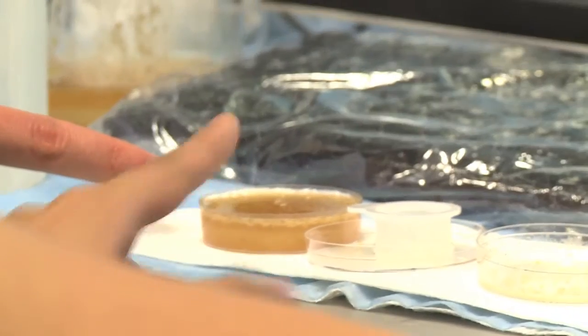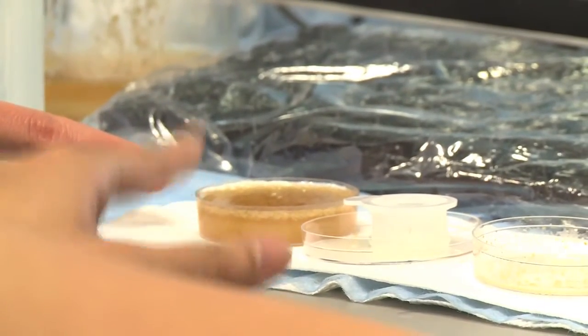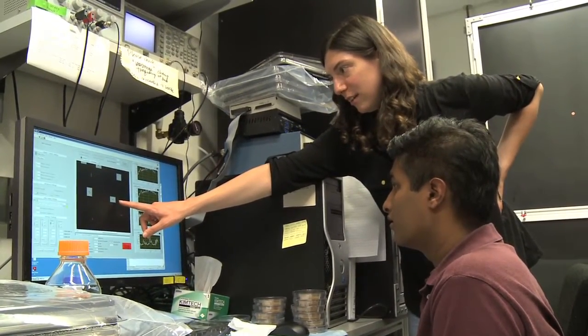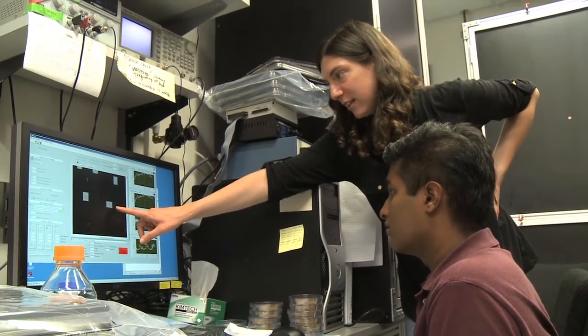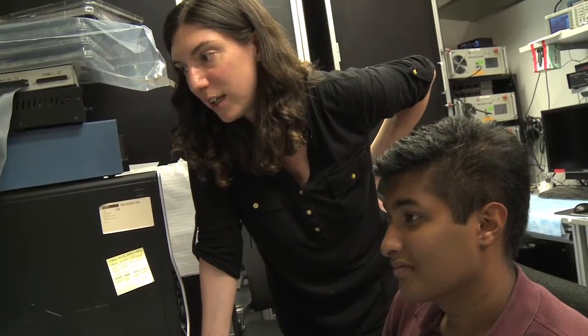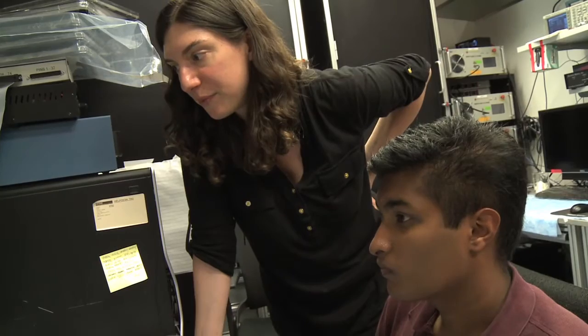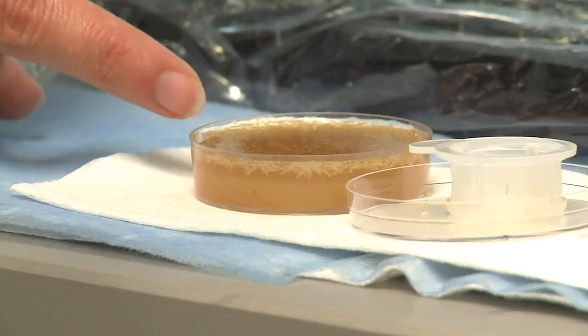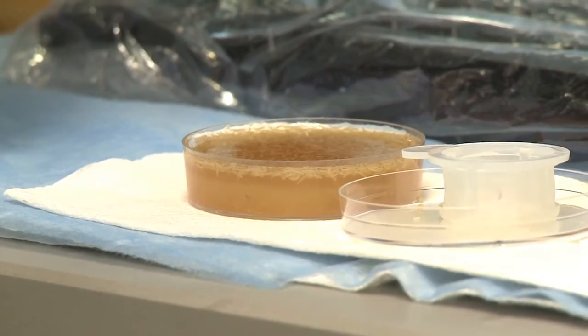This is what I'm going to be running next. She wants me to run three puffs and three controls for each plate. Every time the sound comes on, they retract their heads and head cast. This one reacts strongly — you can see her every time. Nice and big. They are good today, the perfect size.